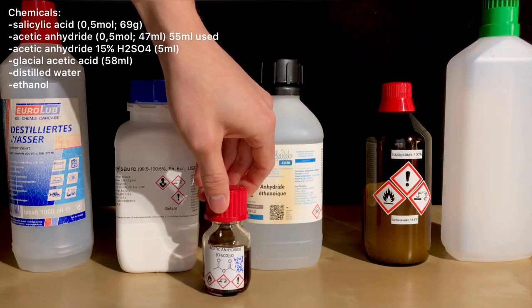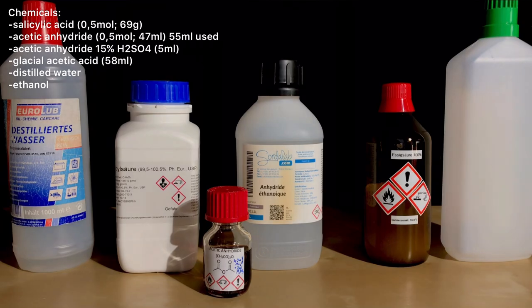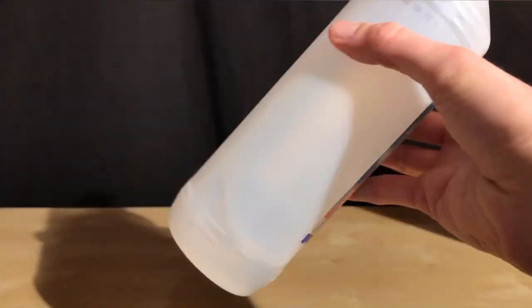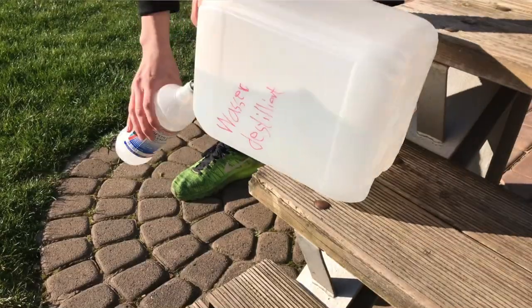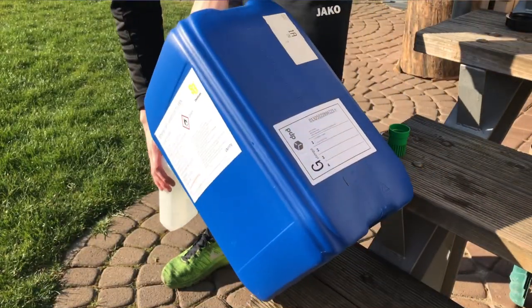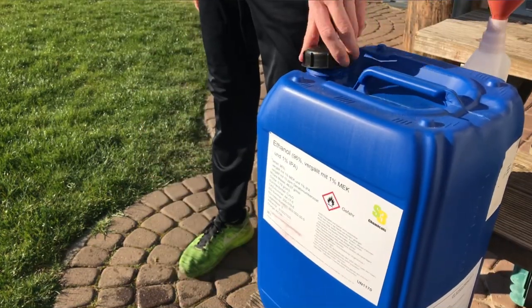The color of this changed to red over time — it is probably still good enough to be used as a catalyst. Like in every single one of my preparations, the ethanol was empty, the distilled water was nearly empty, and the glacial acetic acid was frozen in the bottle. Glacial acetic acid melts at about 16 degrees Celsius, so we put it onto a heater to melt it. The distilled water was refilled from a big canister, and I tried to siphon the ethanol, but after that didn't work I used a funnel and spilled a bunch of it.